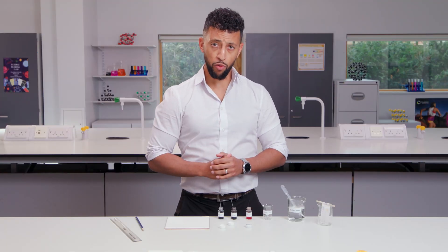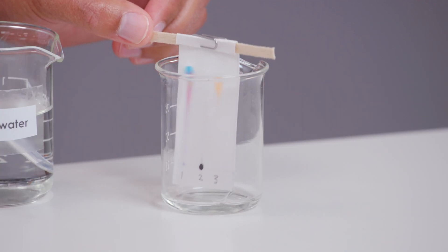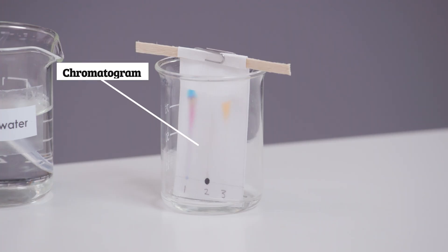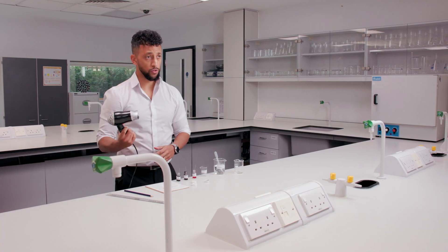Remove the filter paper from the water to stop the inks moving further. This paper with the separated colours is called a chromatogram. I can leave the chromatogram to dry in a warm place or use a hairdryer.